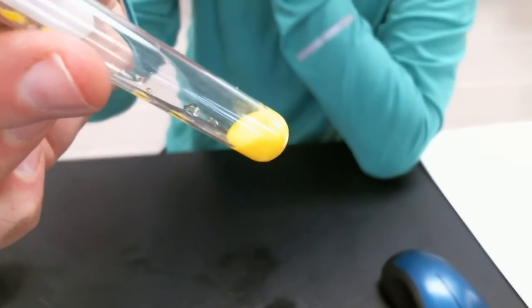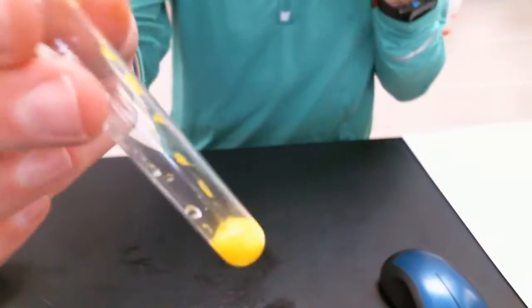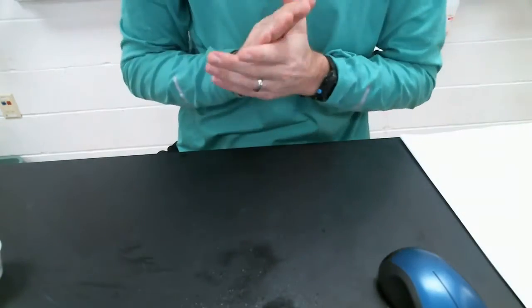So what do you think, chemical or physical? If you said chemical, you would be correct. And guys, this is a precipitate, when you mix 2 solutions together and you produce a solid. And you also had that color change indicator. So that's how we know it is a chemical change.